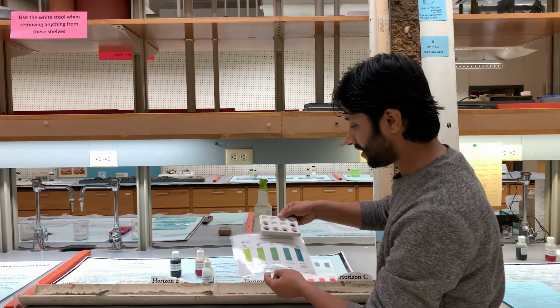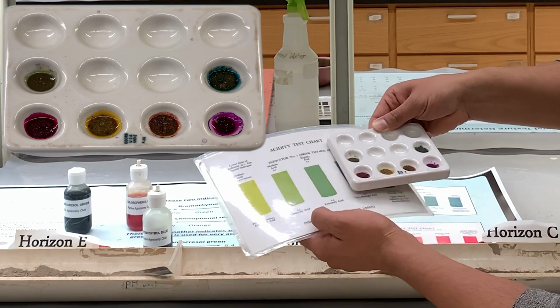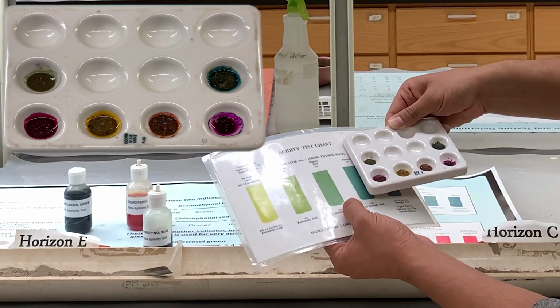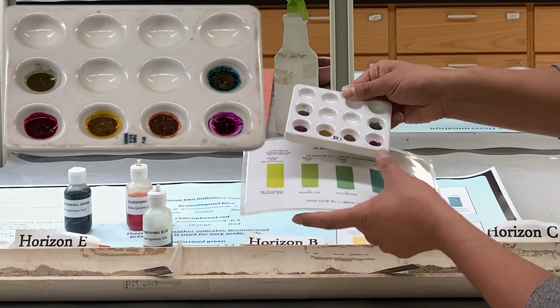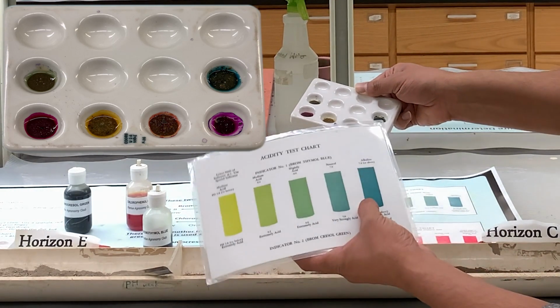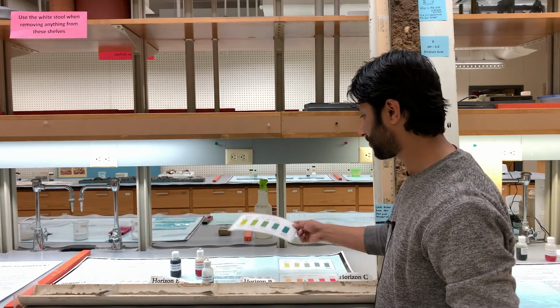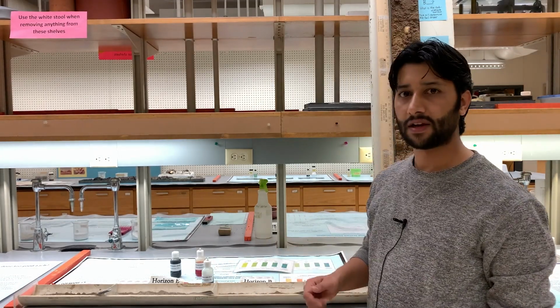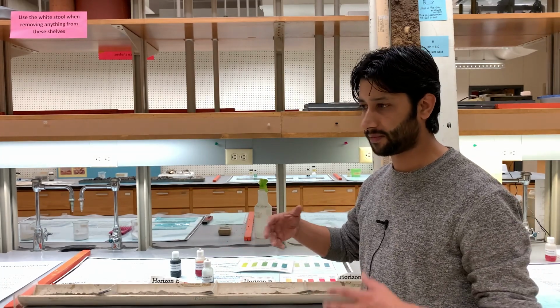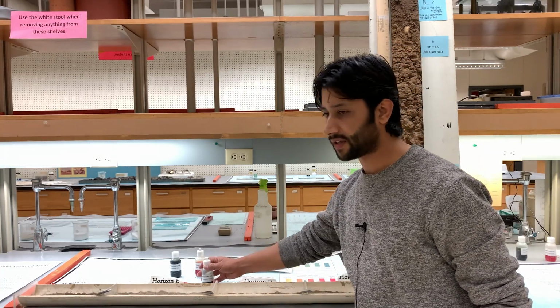As you can see here, the pH of the A horizon is matching around 7ish, and then the color for the C horizon is more like dark green, and that will be 7.4 pH. So this is how you determine the pH of a soil based on the indicator dye. And as I said, you always start with the red dye if you don't have a general idea about the pH of a soil, and then you can move on to these 2 other dyes.